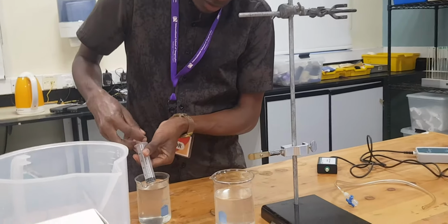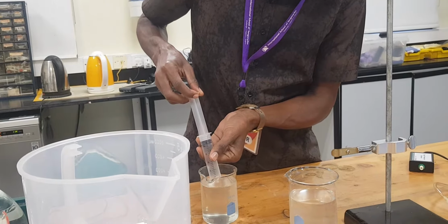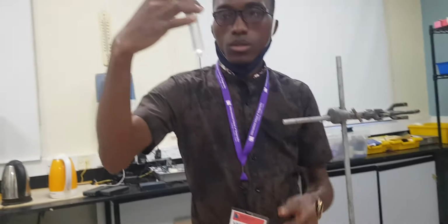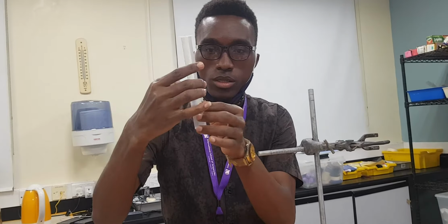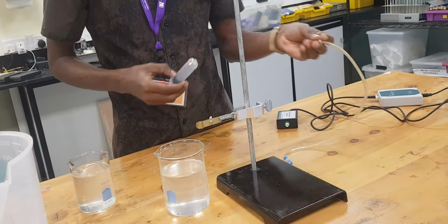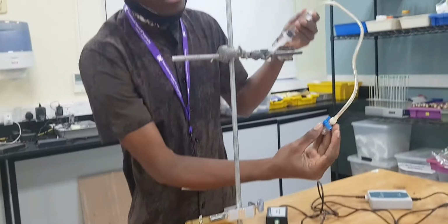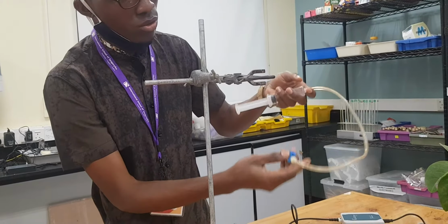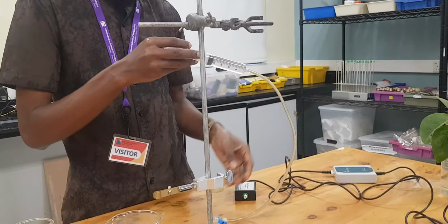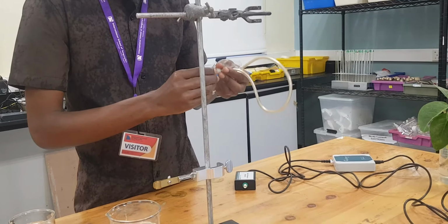So let's take our water here. I think you know how to do it. You can take any volume. So this is our water, right? Now we're going to fill this water in this tube. Remember, we have clamped it well so that the water does not flow, right? So we're going to allow the water into this. Make sure that it has been well clamped.